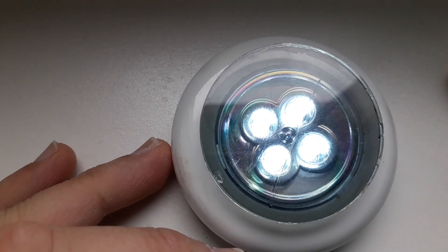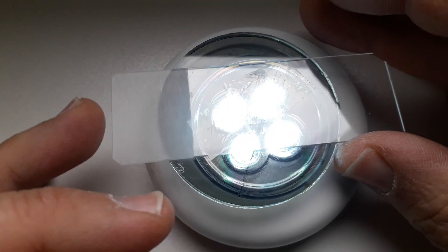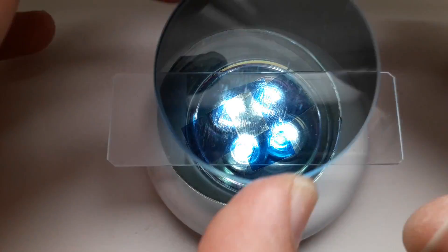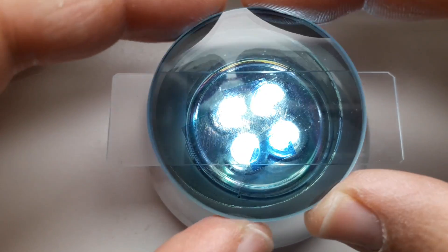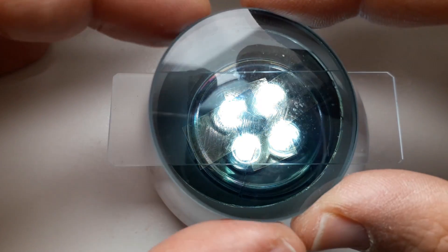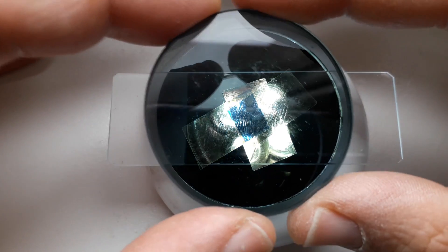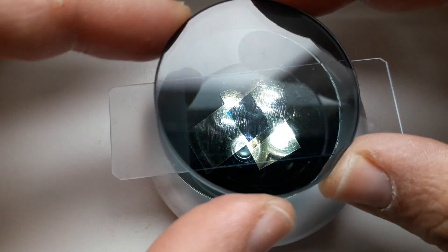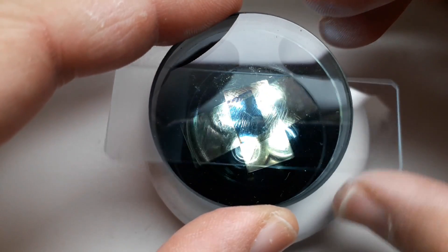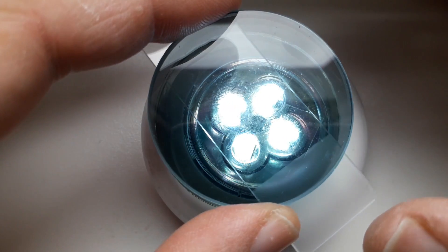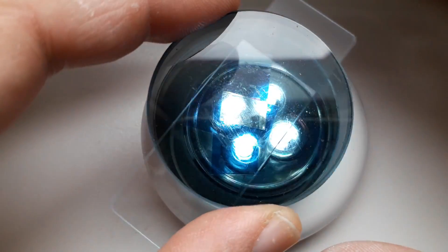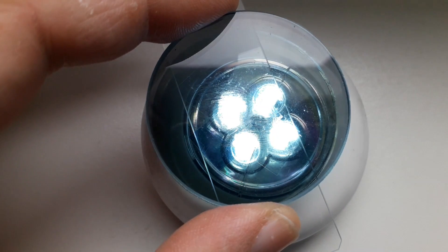And simply to show you the effect without any magnification, I place the slide between two polarizing filters. Of course you can also use those paper polarizing filters from the 3D glasses, and when you turn it then you can see that the colors change quite nicely. It becomes brighter and darker but also the color of the sticky tape starts to change.